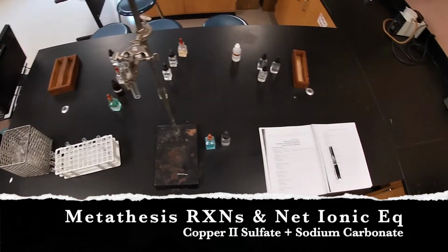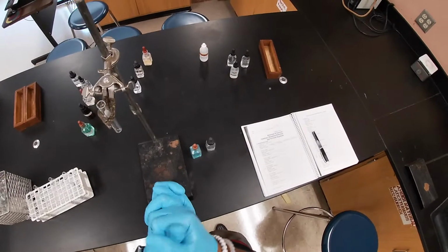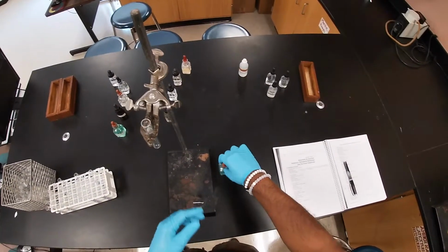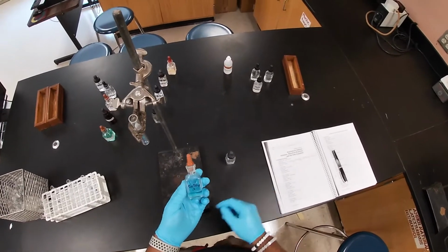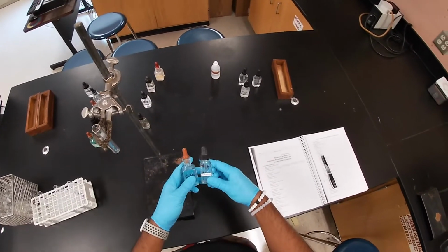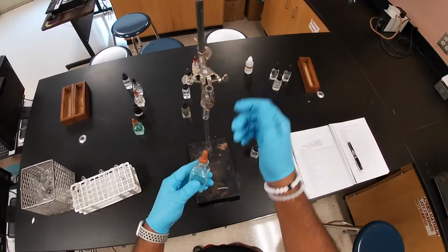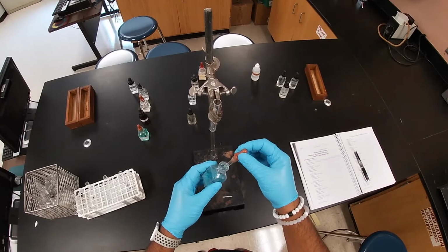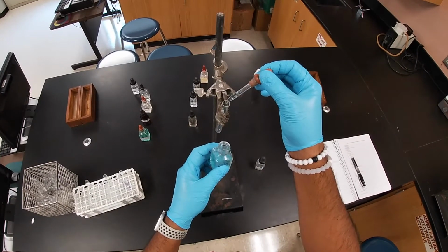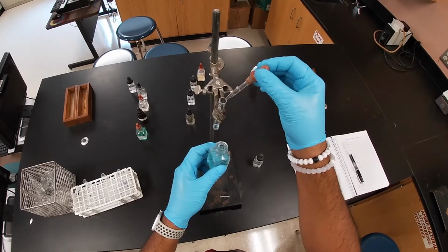Okay, the first reaction we're going to do is in aqueous solutions, the metathesis reactions and ionic equations. What we're going to do first is reaction number 1. It says copper sulfate with sodium carbonate. So I'm going to add enough into this test tube. I'm going to get a little bit of my solution. I'm going to add about a dropper full.